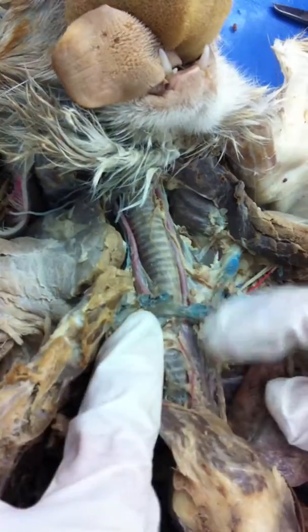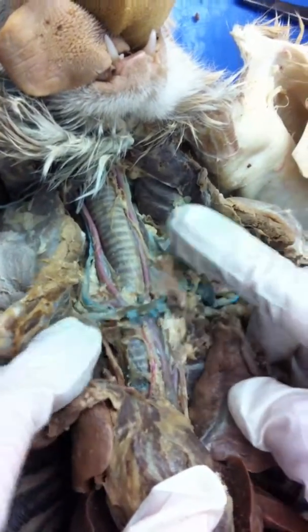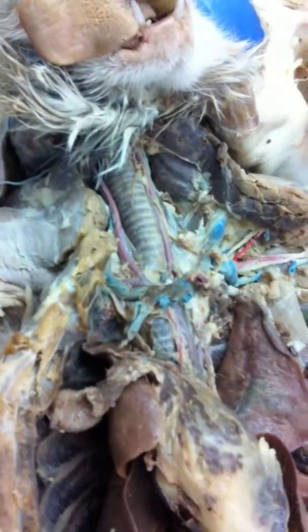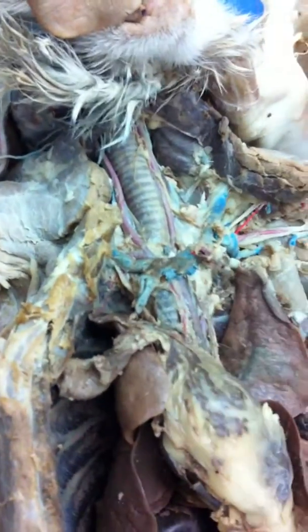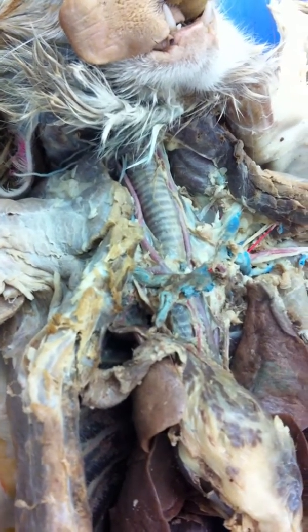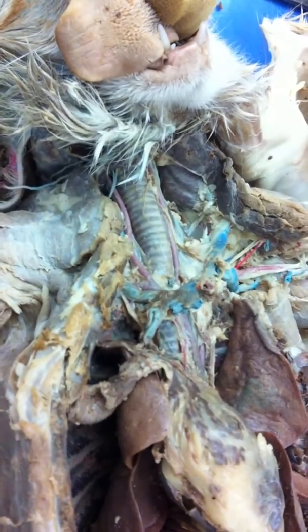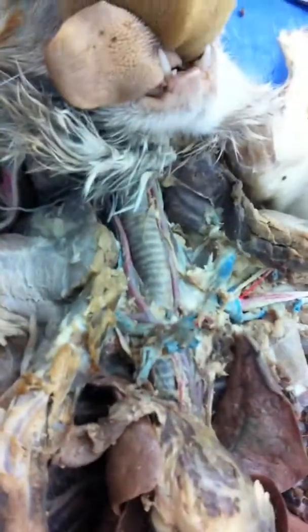Okay. And what was this one in the middle, the big fat one? Brachiocephalic. Okay. What was the one right next to the brachiocephalic? Left subclavian. And then it went up into the armpit. What was the armpit one? Remember? Axillary. And then it came out right here. Brachial. Okay. Figaro, why are you so complicated? I think Figaro's been pretty tolerant of us so far.